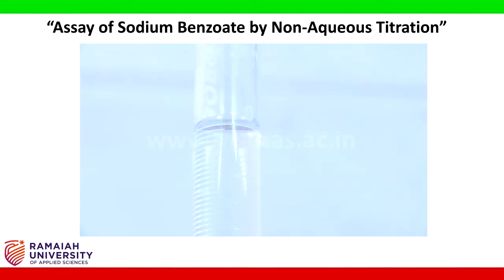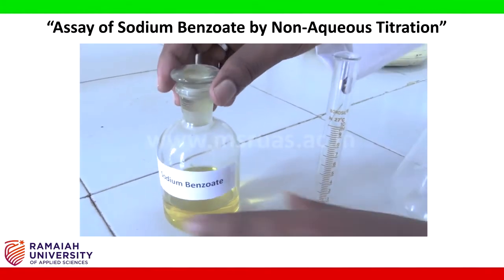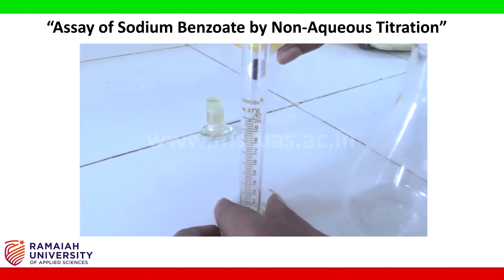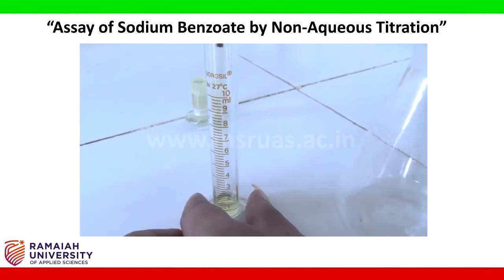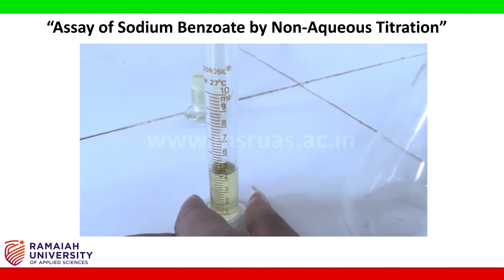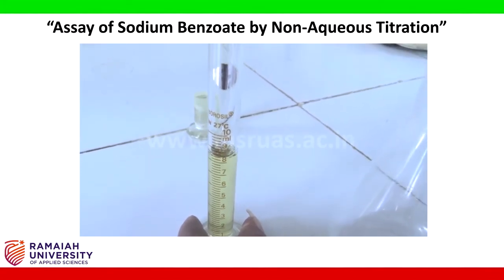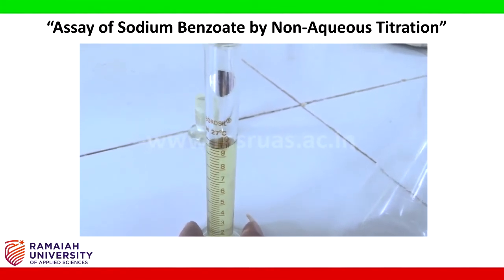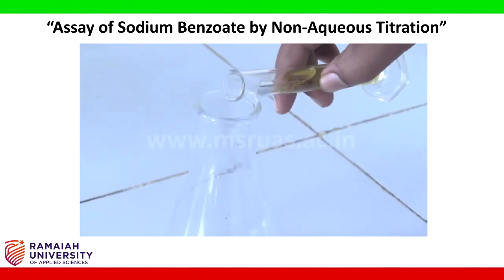Now transfer 10 ml of sodium benzoate using a measuring cylinder into the conical flask.